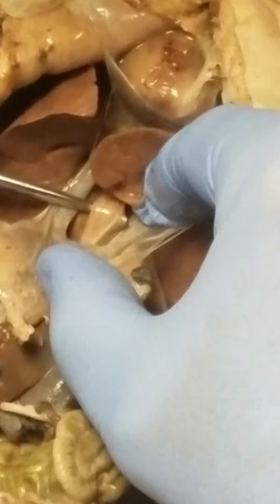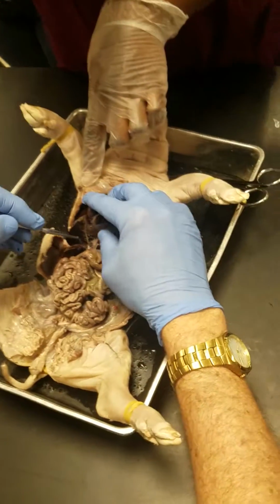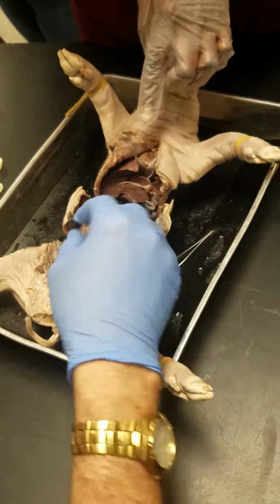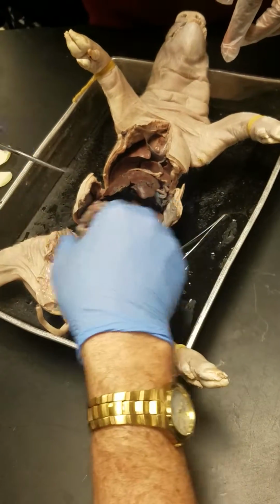I let the pigs talk to me. Oh, I've learned my lesson. I do not write the key out ahead of time. I pull the pigs out, I line them up, and I go, oh, okay, good. This is the one with a good gallbladder, so I'll do this one for gallbladder, cystic duct. And then I go, okay, I need a boy pig, obviously. I need a boy pig for boy parts, and a girl pig for girl parts. And then I'll do one basic digestive system pig.